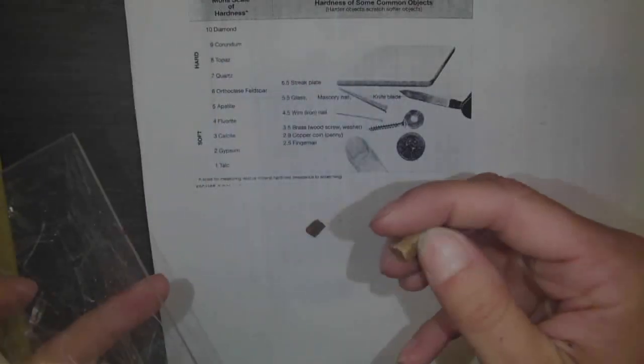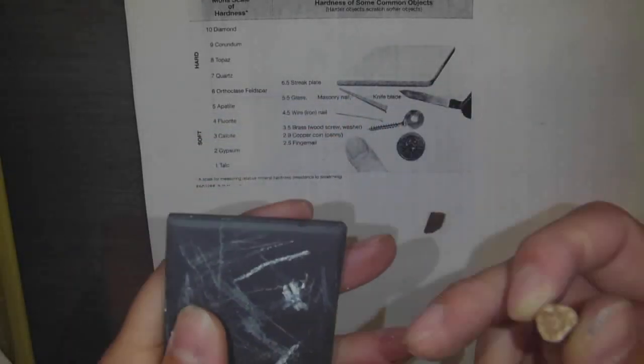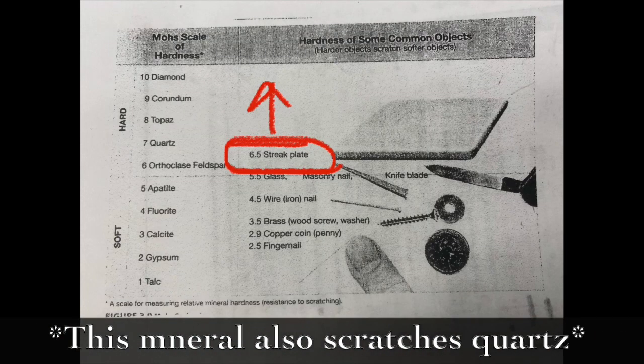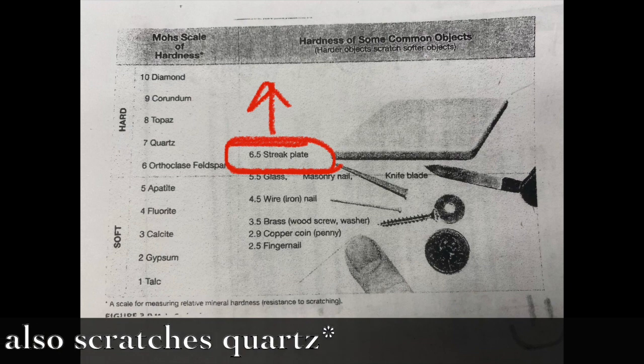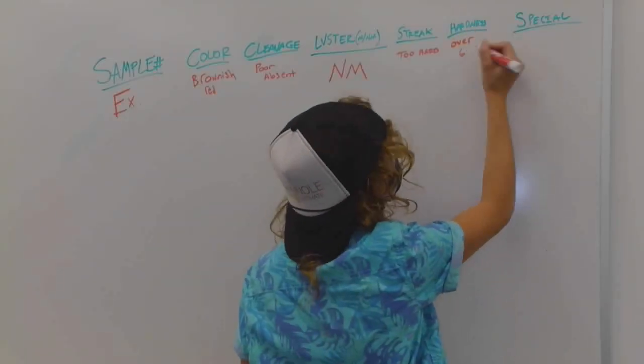For our mineral example, you're going to see me scratch the mineral example on some glass, and you're going to see that it scratches the glass. And we also know from our previous test that it scratches the streak plates, both of them, doesn't have a color, just puts a line right through them. And so we can take our little scale here, and we can say, oh look, it's harder than the streak plate. So we know that the mineral has to have a hardness that is over 6.5.